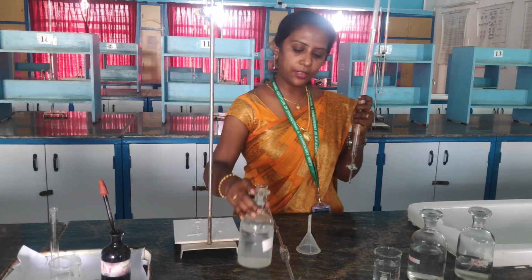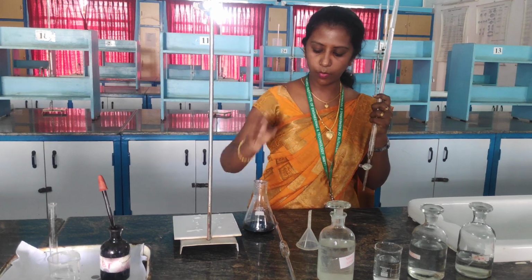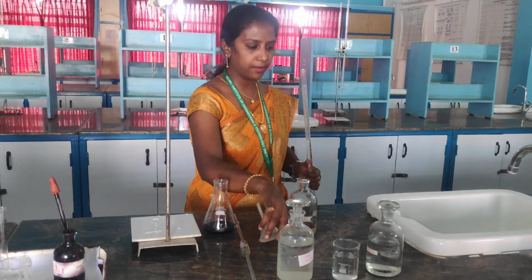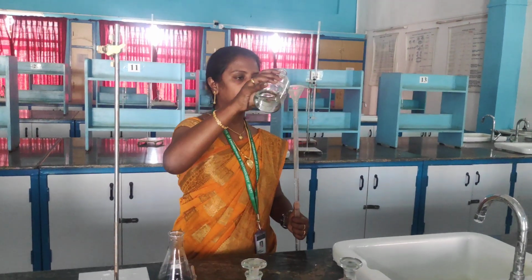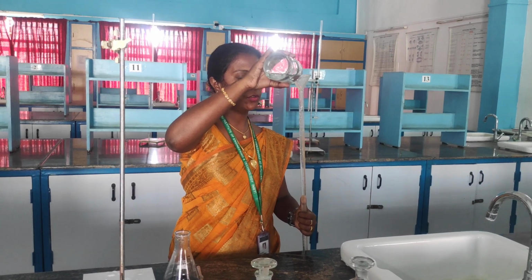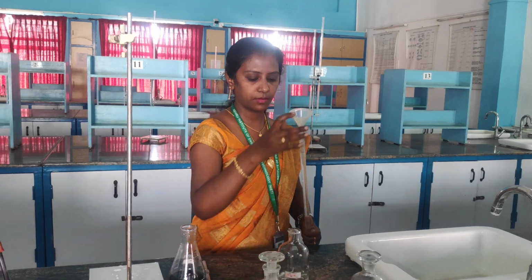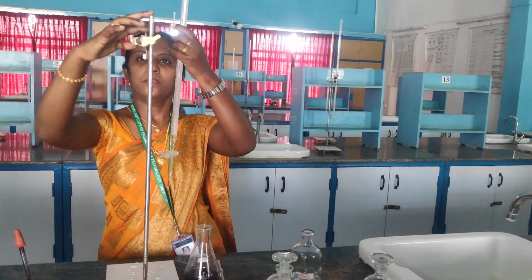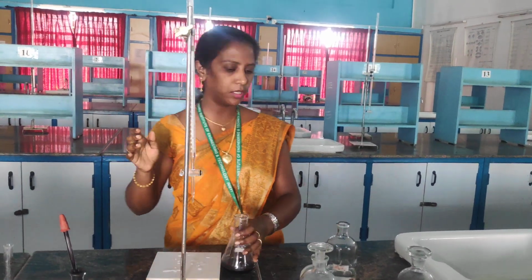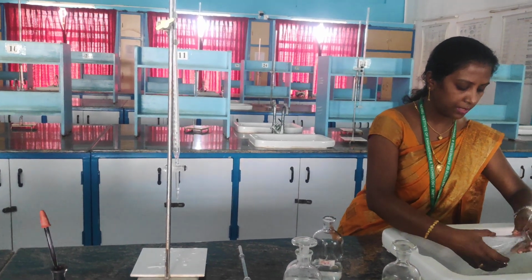And the last titration we are going to do with boiled water. Again I will fill my burette solution with EDTA up to 0 level. Again we have to fill the solution. Right? Okay. So the next thing I am going to do is, I am going to pipette out 20 ml of boiled sample water.